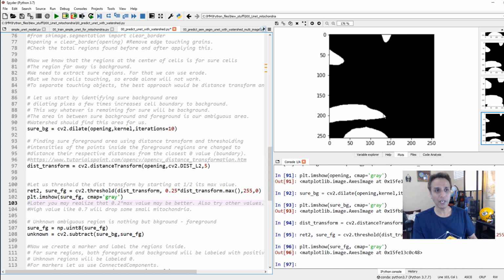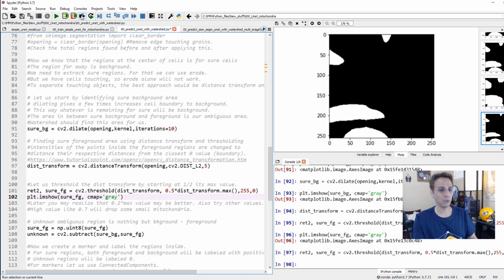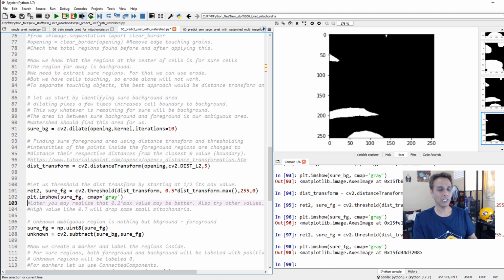So I'm kind of defining it, but it's like erosion. Okay, a few pixels. I'm defining the shape. This is where I'm telling that, hey, I know for sure this is my mitochondria for sure. Okay, that's exactly what we are doing. Now, the reason why I said you should be a bit careful about this value is, let's go ahead and change that to 0.5 and run this again. You see how I'm like eroding this, or making this too small, right?